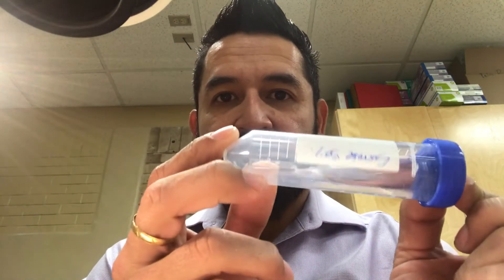Hola, I'm going to show you how to get the embryos and the larvae that you need for your laboratory practice. So what you would need is a paintbrush, a sucrose solution, water, an empty petri dish, something like this, and of course your larvae.